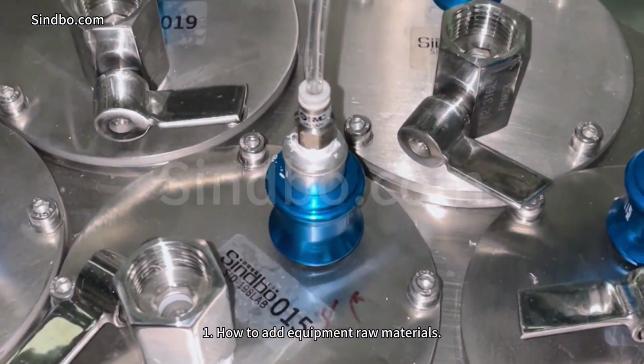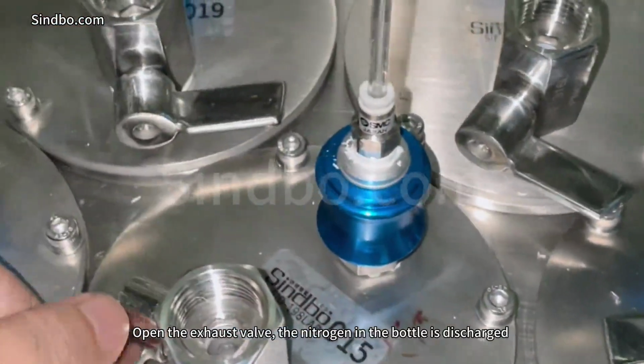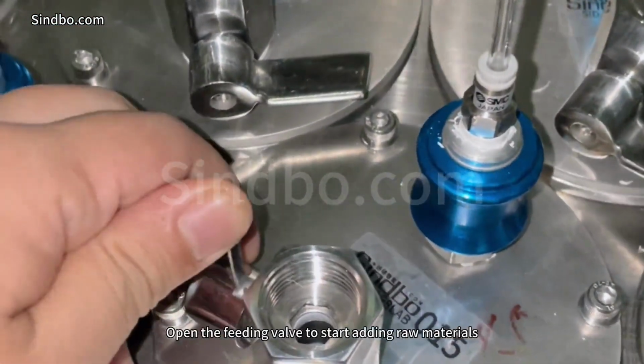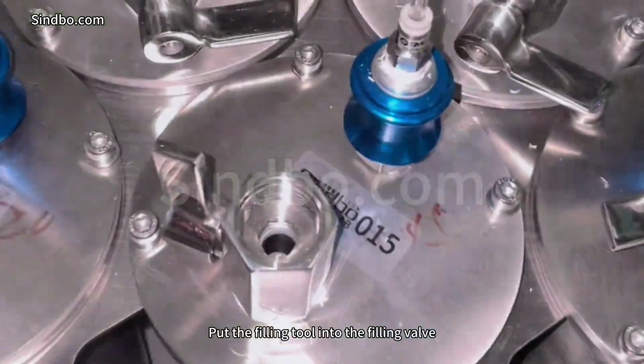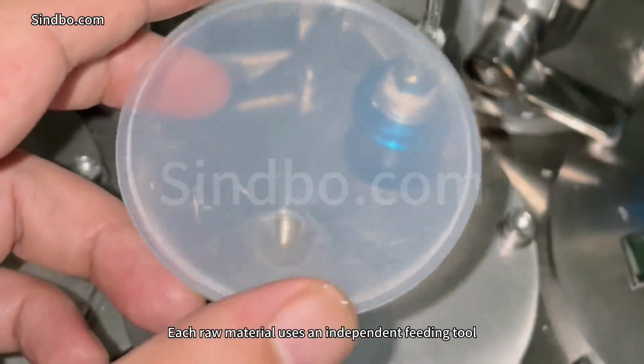1. How to add equipment raw materials. Open the exhaust valve. The nitrogen in the bottle is discharged. Open the feeding valve to start adding raw materials. Put the filling tool into the filling valve. Each raw material uses an independent feeding tool.